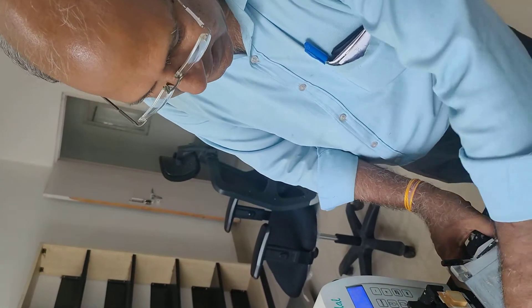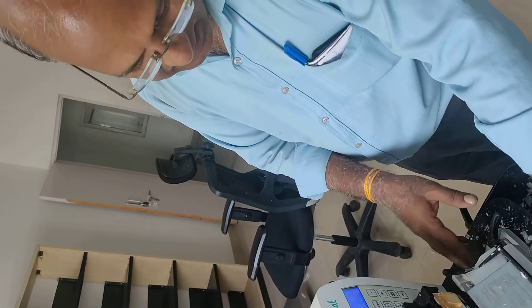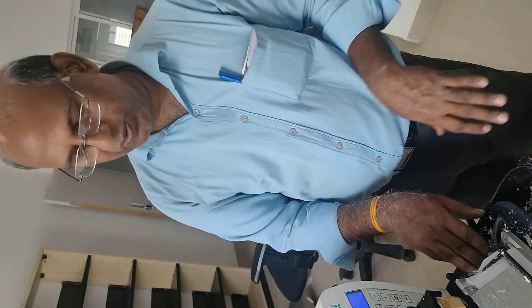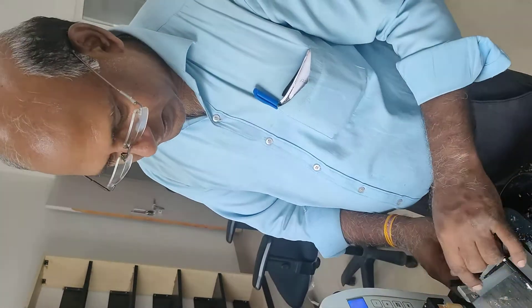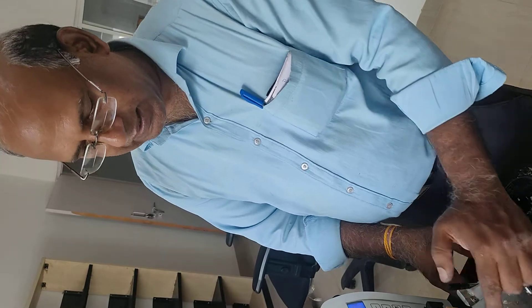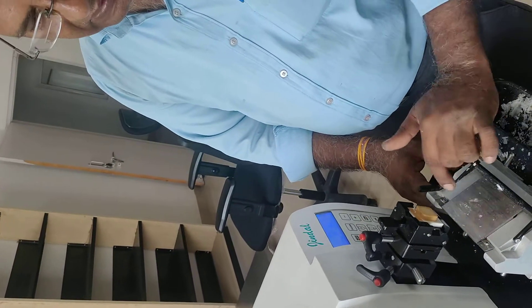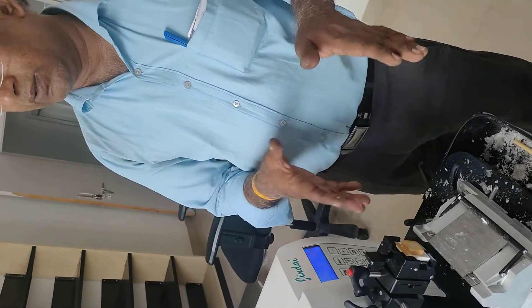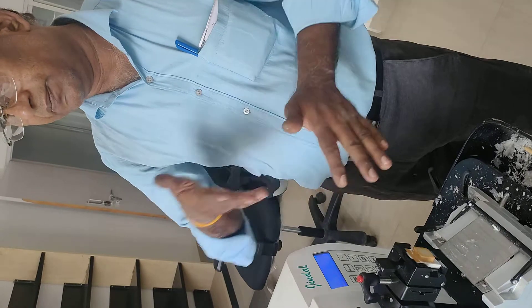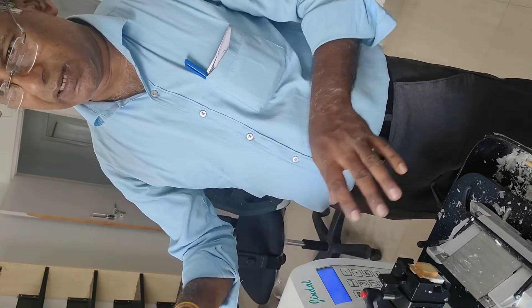This is for lateral. We can do both of these operations. We have to trim the same way. We can do both of these operations without the blade. We use one blade only for trimming. We have cut from 50 to 60 blocks.